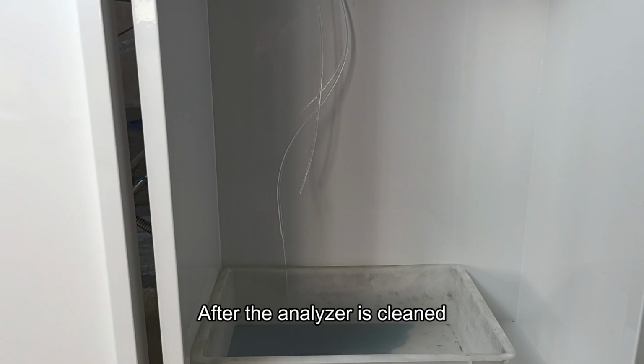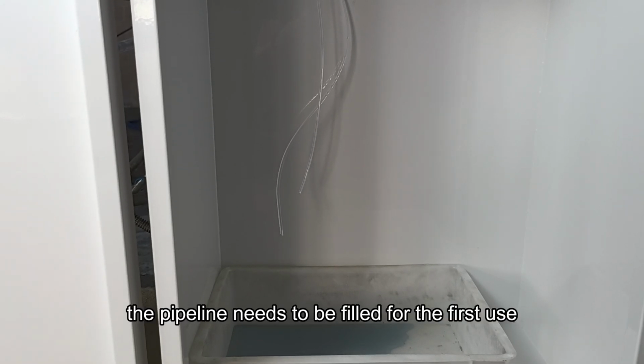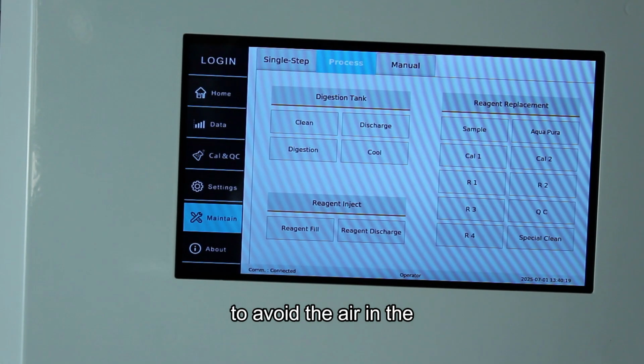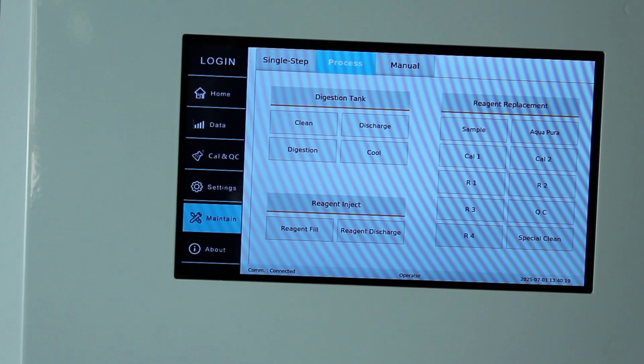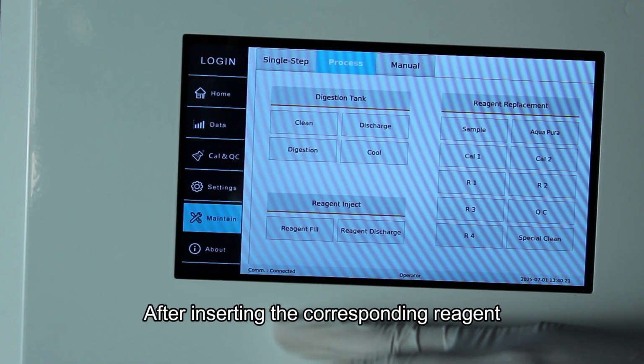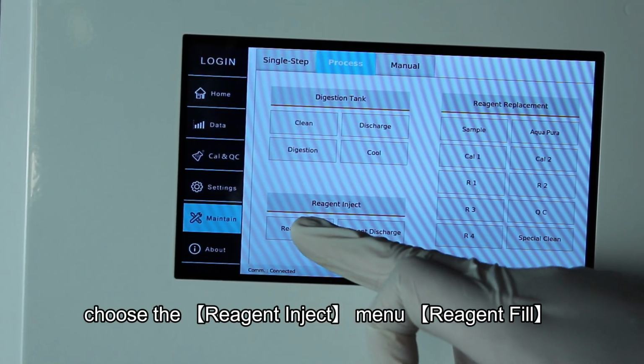After the analyzer is cleaned, the pipeline needs to be filled for the first use, to avoid the air in the tube being sucked in during measurement, causing measurement errors. After inserting the corresponding reagent, choose the Reagent Inject menu, Reagent Fill.